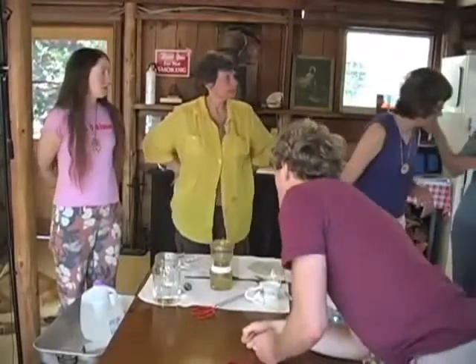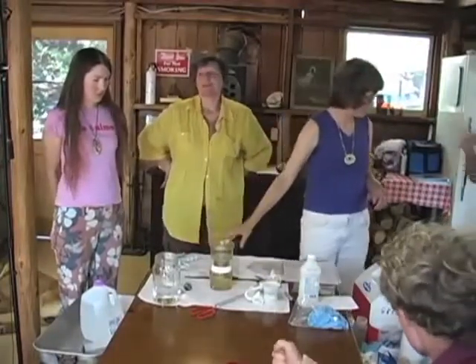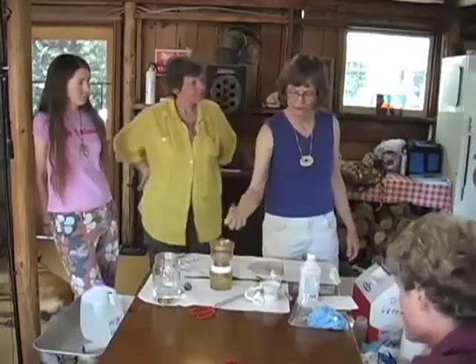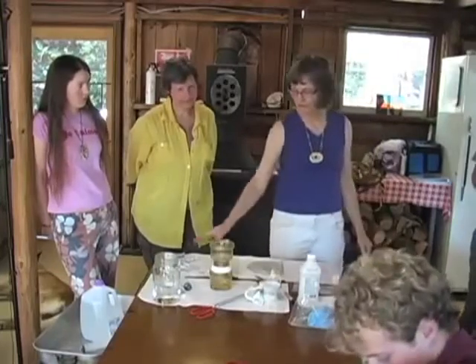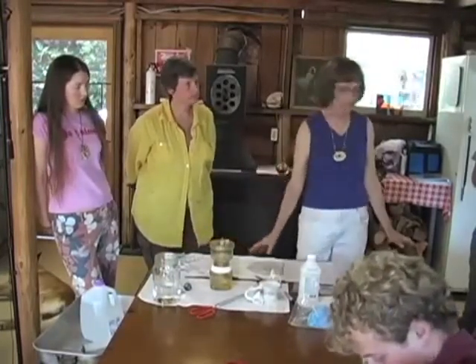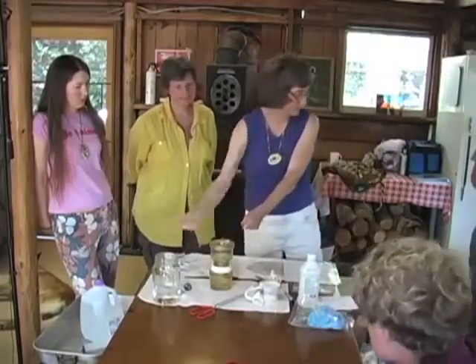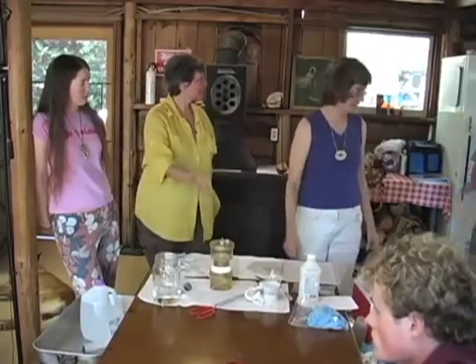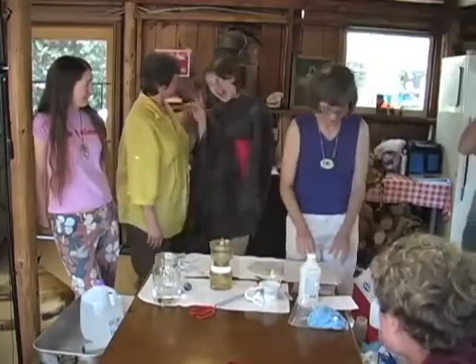Pardon me. We didn't hear what you were saying, so we kind of did that process. Oh, that part there? Yeah, well, basically, you're trying to create a vacuum which draws the water through the filter. And I'm saying that the pump is expensive, but it's a luxury, because otherwise the students had to use a syringe and pull it through by hand, and it took a long time. So this is nice. It saves time. I'm sorry, I wasn't that patient. So moving on to the next part.